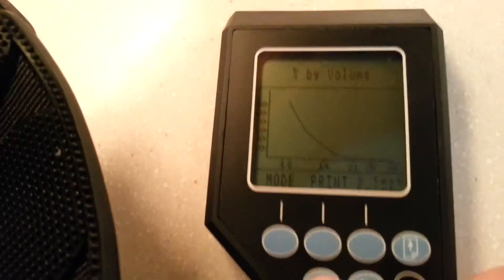I'll just see what we're saying here now. So that's our ISO count, which is excellent.